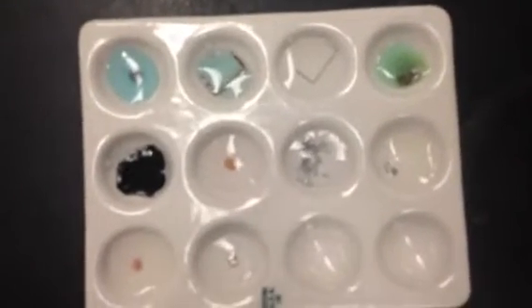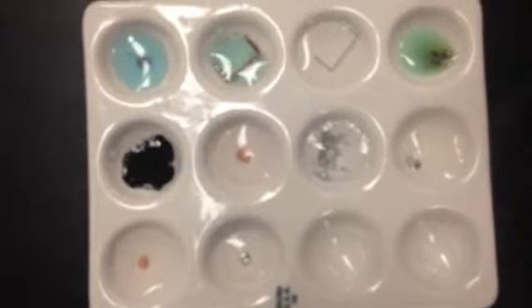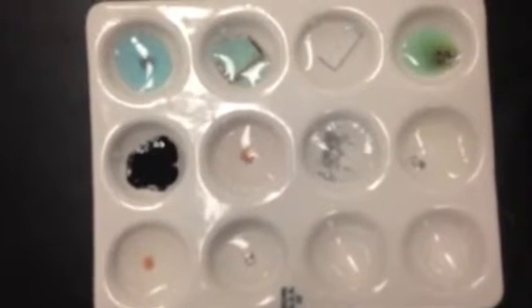So there are our reactions. Again, you are figuring out which metal is more reactive in each pairing. So of the lone metal versus the metal that's a part of the compound, if there was a reaction, if you did see a sign of reaction, that means that the lone element is the more reactive metal than the one already in the compound, and that's why we're seeing a reaction.